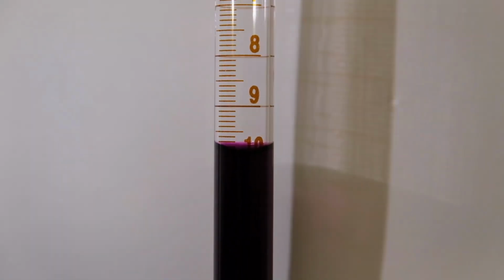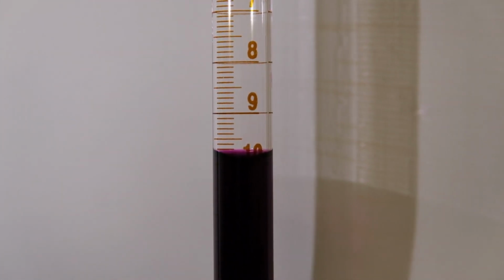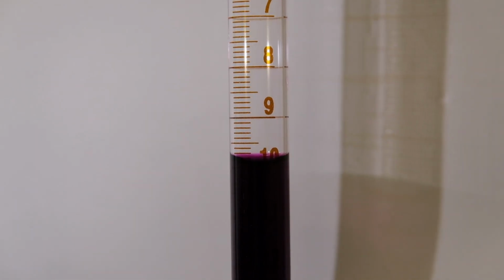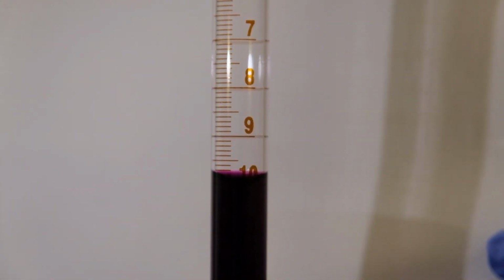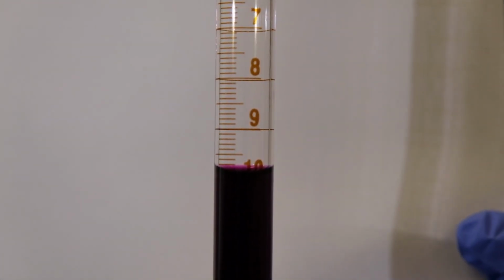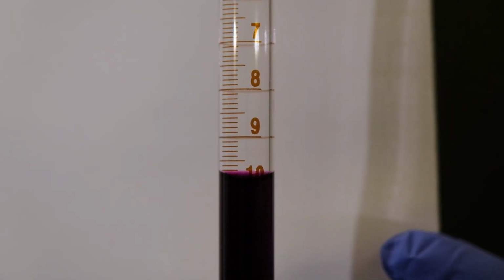Okay, 3, 2, 1. One more time, right now. This is the end point of the second titration. Record the volume that you read to the second significant figure after the decimal point. We need to have consistent values of the volume, which means the values had to be plus or minus 0.01 difference between each other.